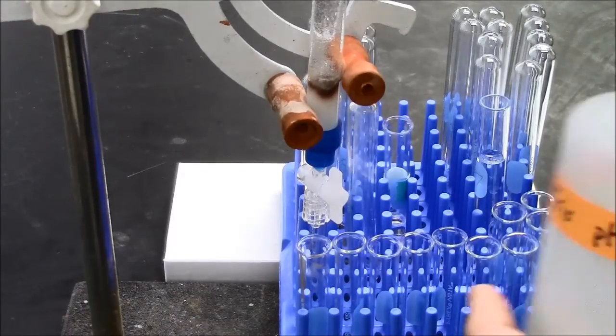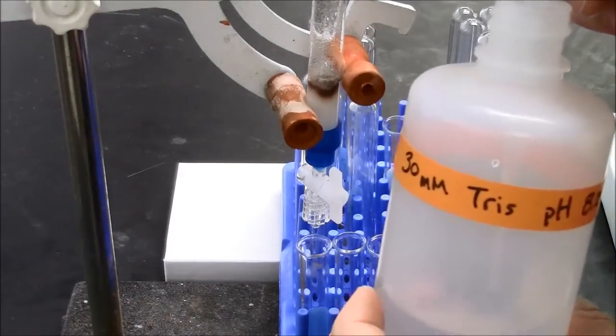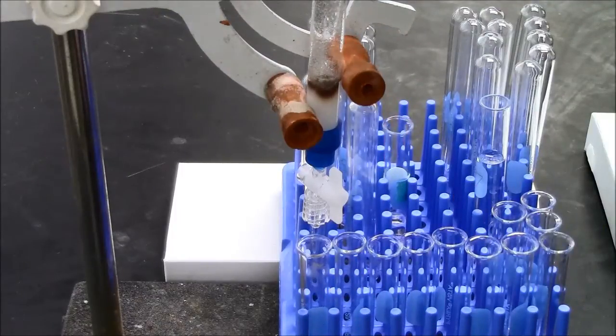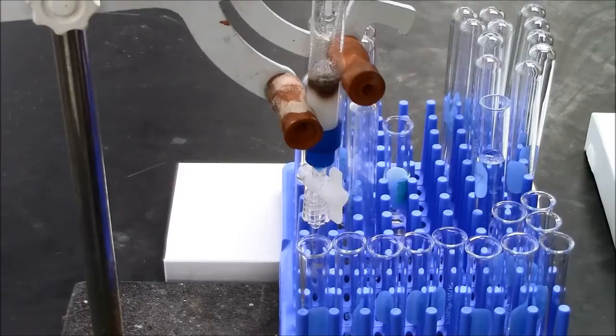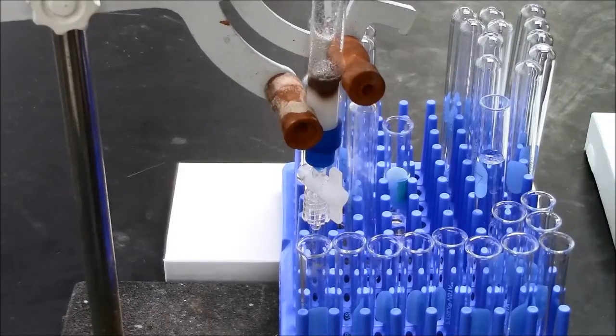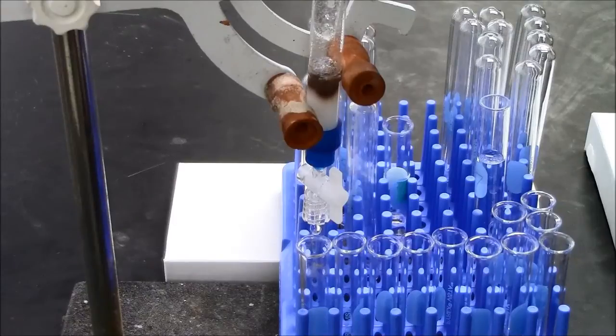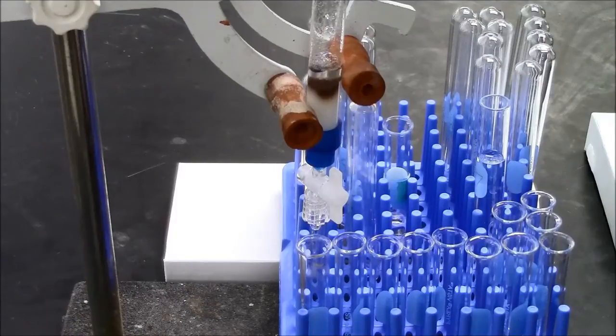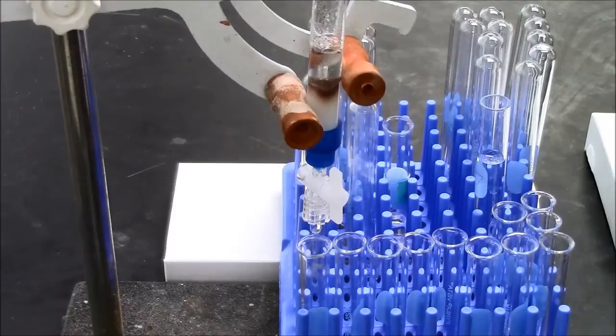I'm now adding my wash buffer, the same buffer I used to equilibrate the column. And again, I'm gently adding on the top, trying not to disturb the gel bed. And I'll let that flow in.